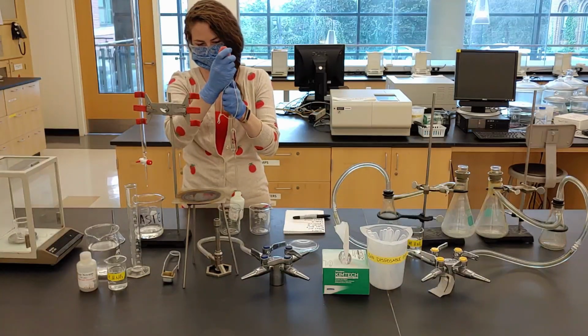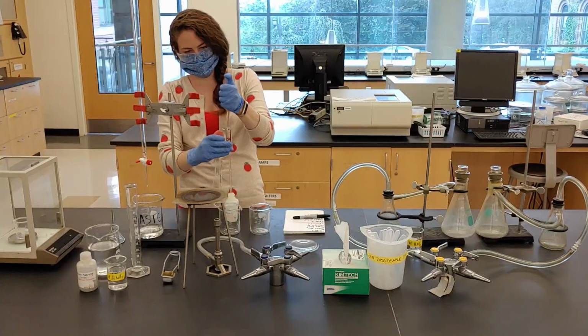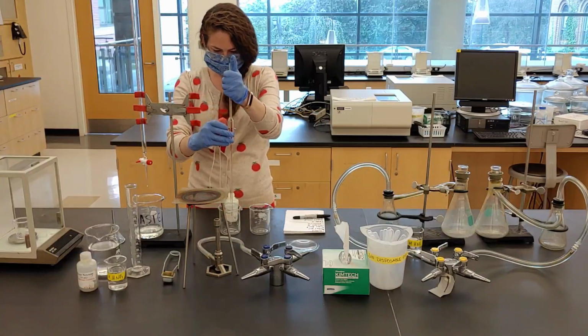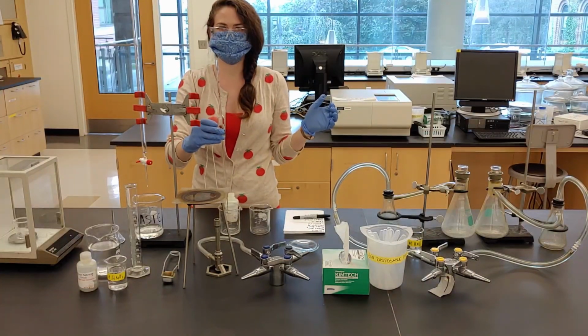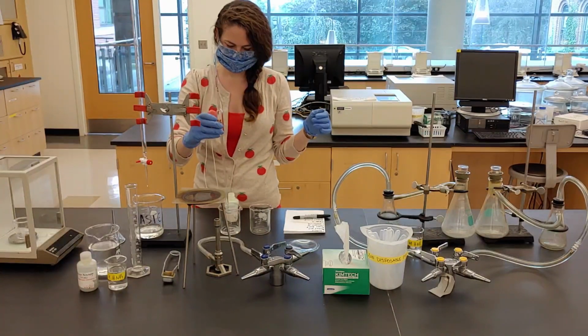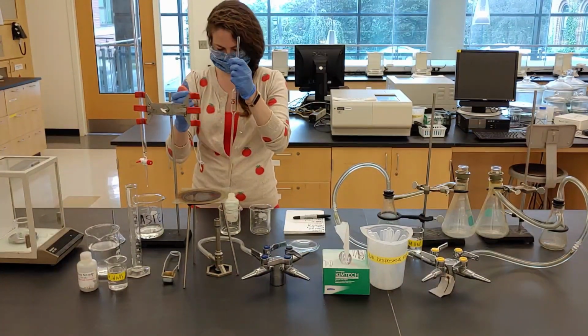We are conducting 2 trials, both with the same volume of potassium chloride, but with different volumes of our second reactant, silver nitrate. This will show how changing the amount of a reactant added impacts the product formed.